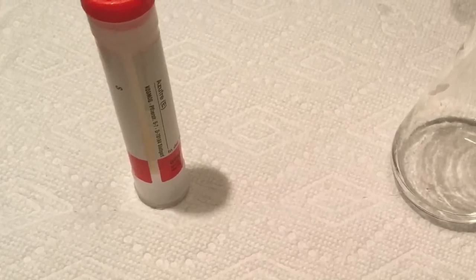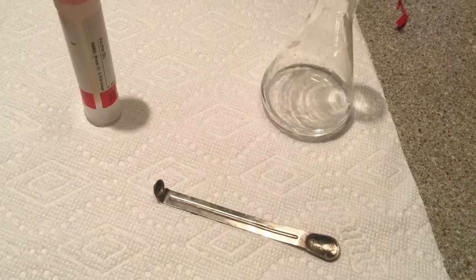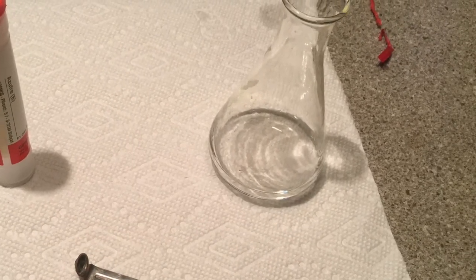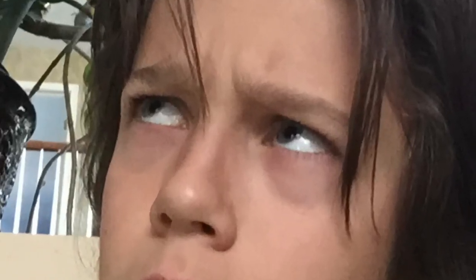We will need a bottle of sulfur, a measuring spoon, and last but not least we will need an Erlenmeyer flask filled with 10 milliliters of water. Wait — who broke my measuring spoon?